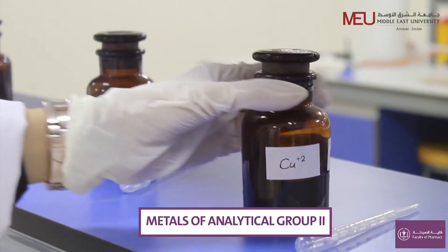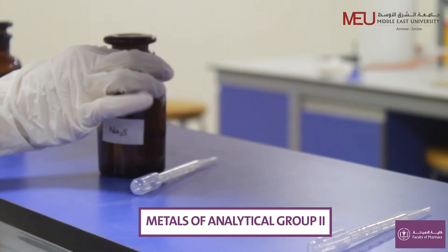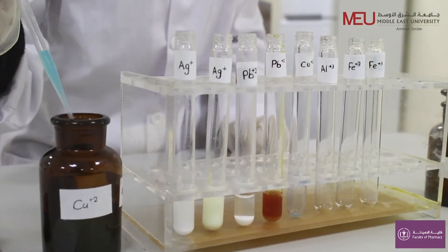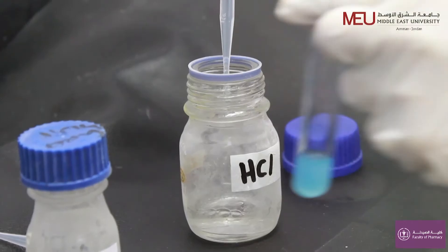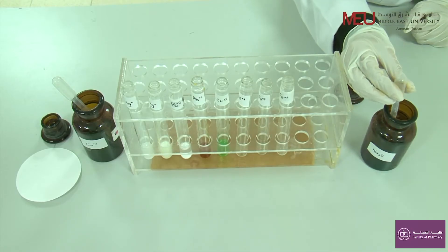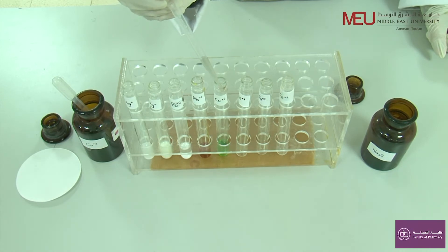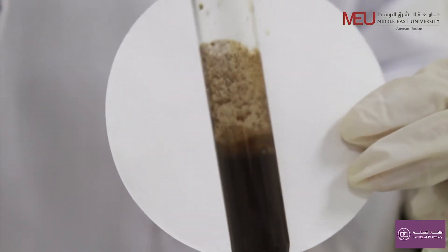Metals of analytical group number two are precipitated as sulfide in acidic media. This group includes copper ion. Copper ion is a blue ion, and can be identified by adding 1 ml hydrochloric acid and a few drops of sodium sulfide. A black precipitate will be formed.